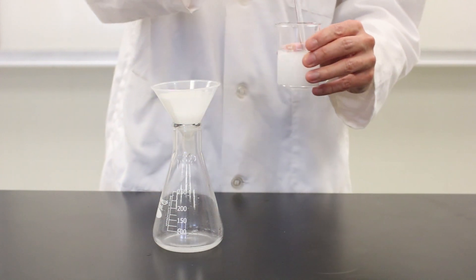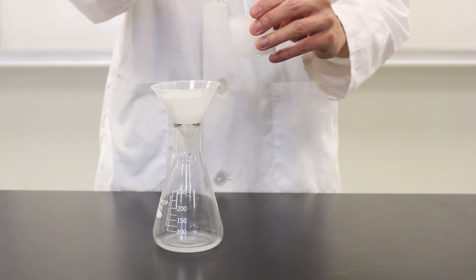Okay, round two. Again, stirring to suspend the precipitate and pouring against the rod.